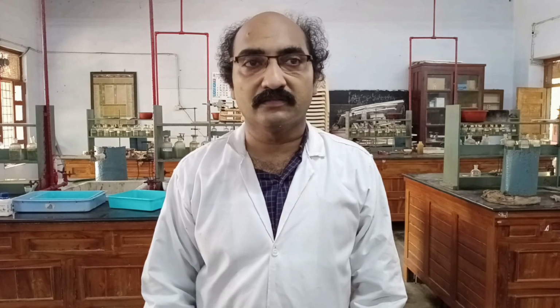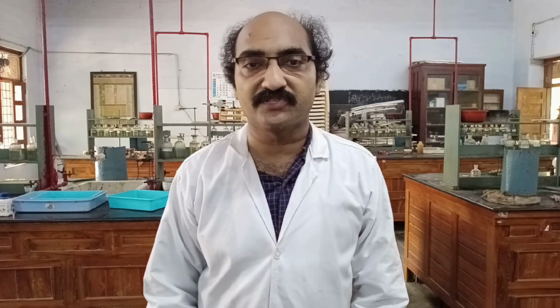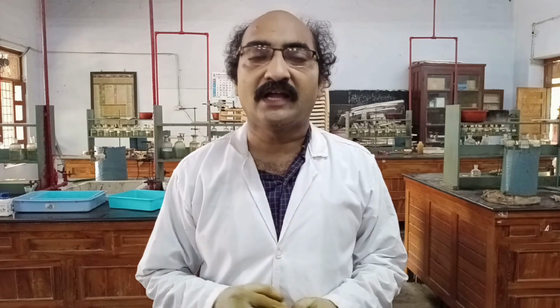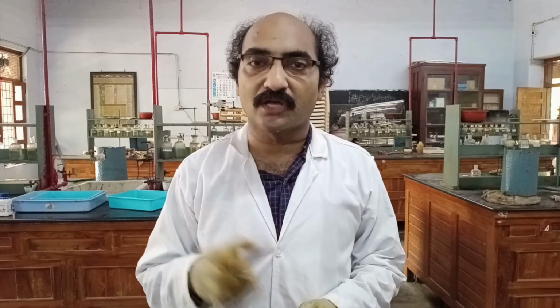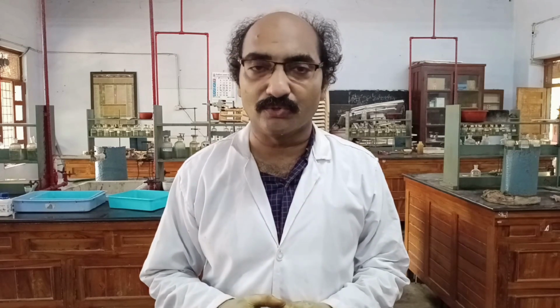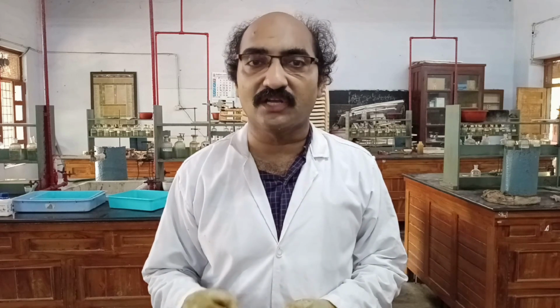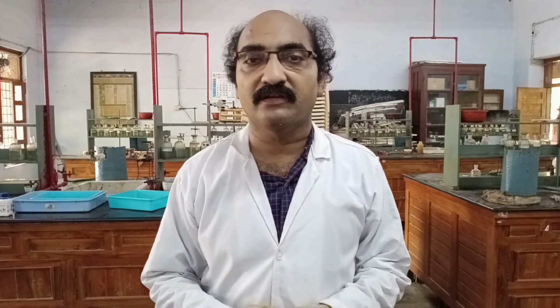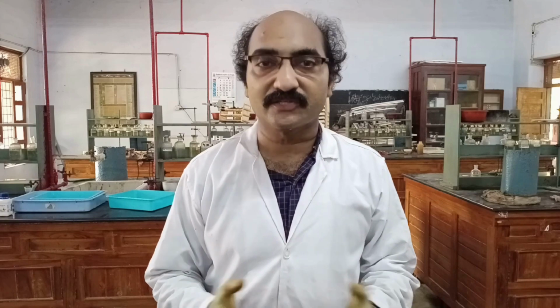After performing the test for ammonium ion, we need to go for the general group separation table. For that, we need to prepare the original salt solution. For this, I need to take a little amount of salt mixture into a test tube and add a suitable solvent. Because the given salt is soluble in cold water itself, I am going to prepare my original salt solution in distilled water itself. So let us look at that first.